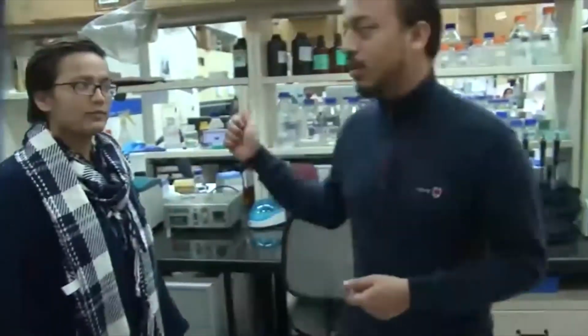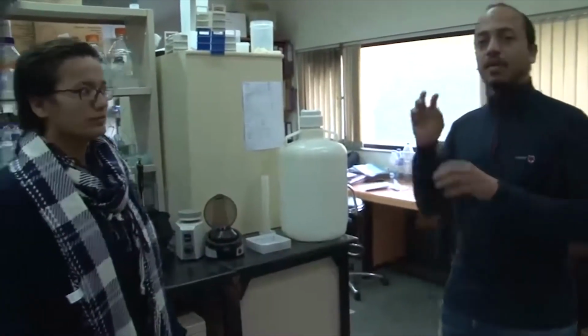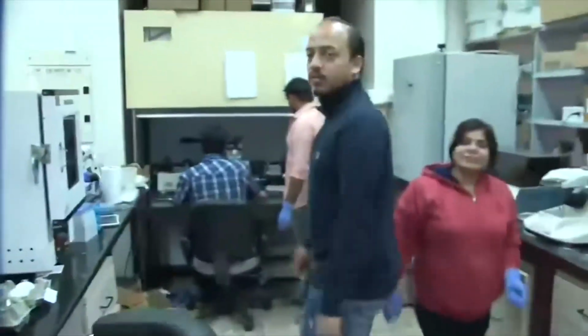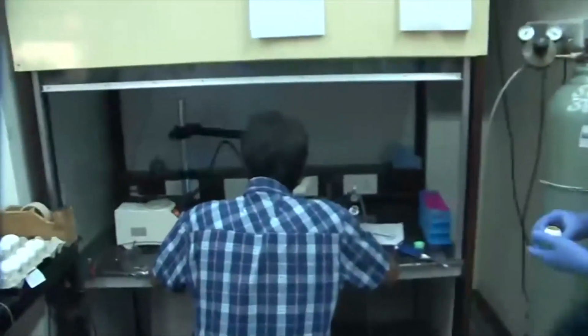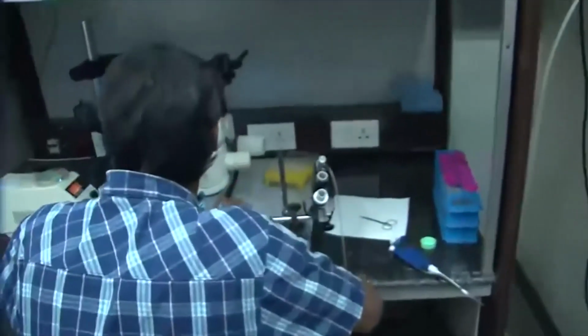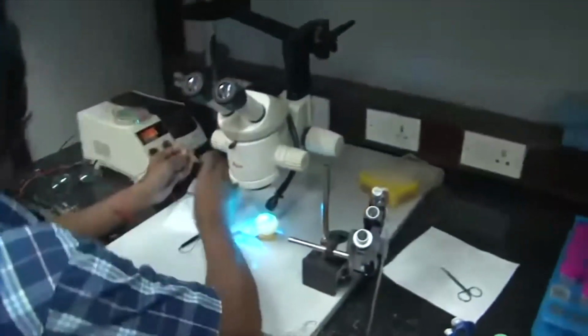There's a student who is already performing electroporation, where we introduce the DNA with the help of voltages. DNA being negatively charged, we inject the DNA into a pouch, maybe the limb pouch or the brain pouch, and then we use electrodes. It's almost like giving a shock, and the DNA moves inside the cell, and then we have the genome ready for manipulation with the viral DNA. This is our electroporation chamber, and this is Baba, an MTech student of our lab. Now he is using the electrodes.